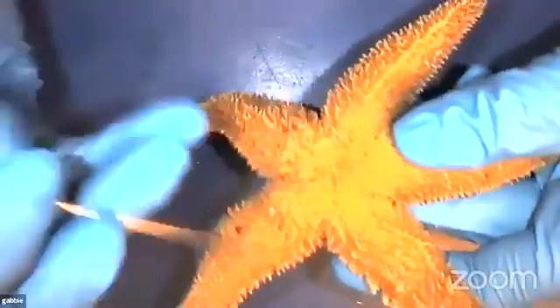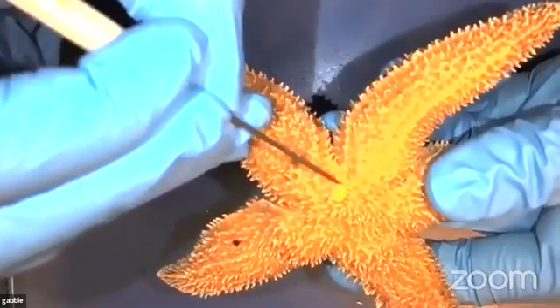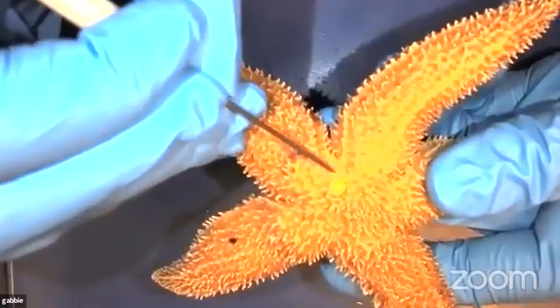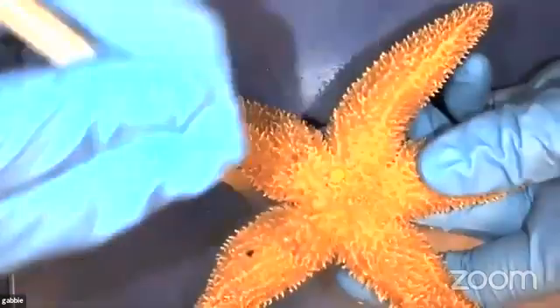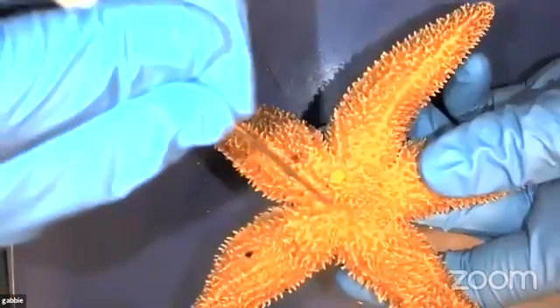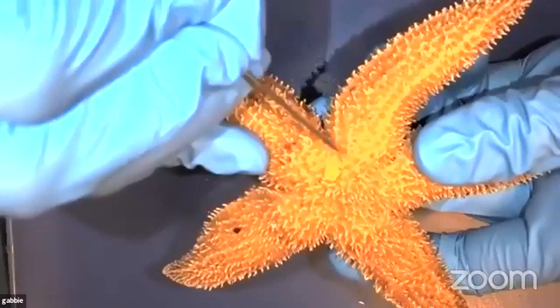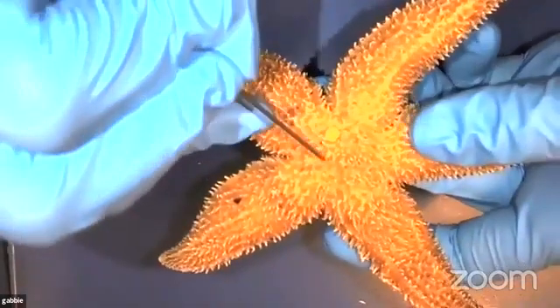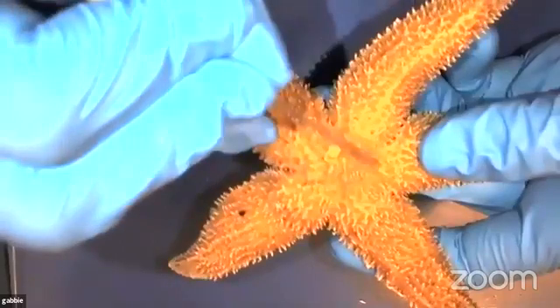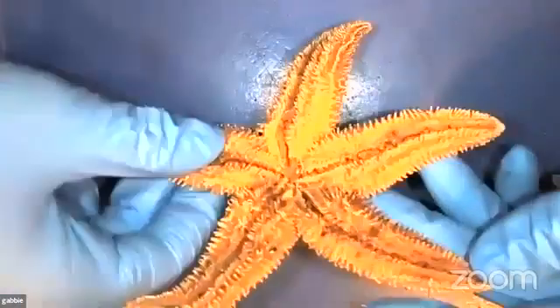get oxygen. If you can see this little hole right here, this is a hard disc. It's called the madreporite. Now this is super, super specialized just to sea stars. They are pretty simple, but this is really awesome. This is a cool water system that they use in their body. And this is also what helps them pump their little tube feet full of water. It's a special water vascular system. This helps bring it throughout their entire body, and it's really specialized.